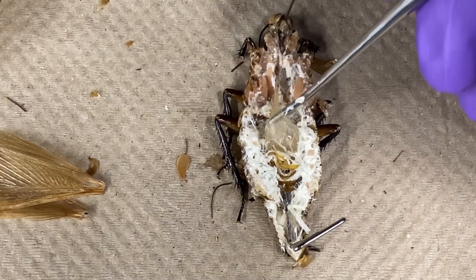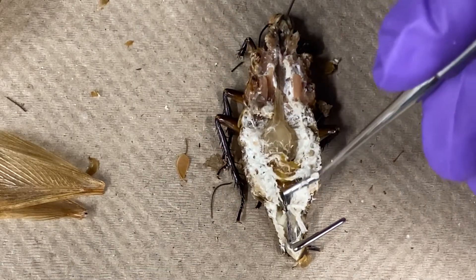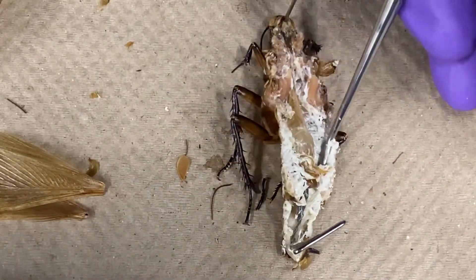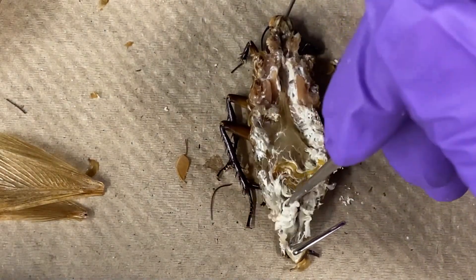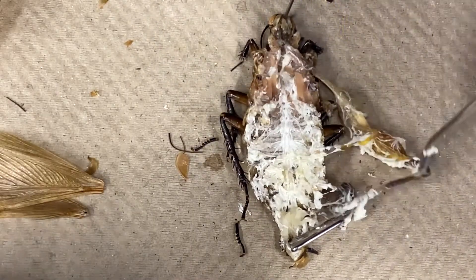The esophagus can be found near the head. Once it has been identified, the tube of the digestive tract can be followed all the way to the anus. Using forceps or a bent probe, the fat bodies around the digestive tract can now be carefully removed to expose the esophagus and crop. Using a teasing needle or dissecting probe, tease apart the coiled digestive tract.